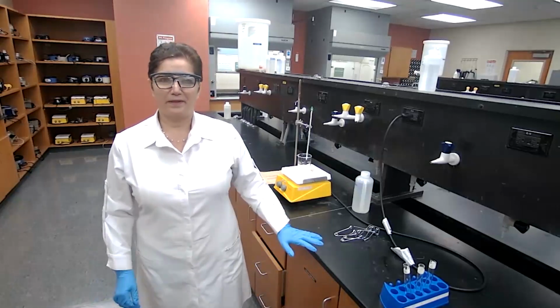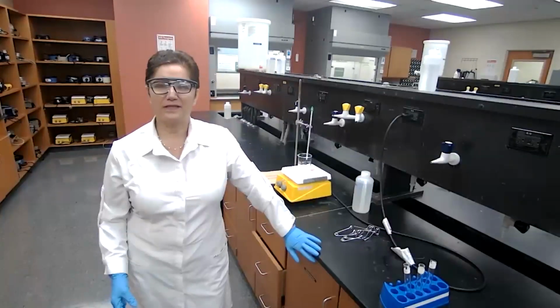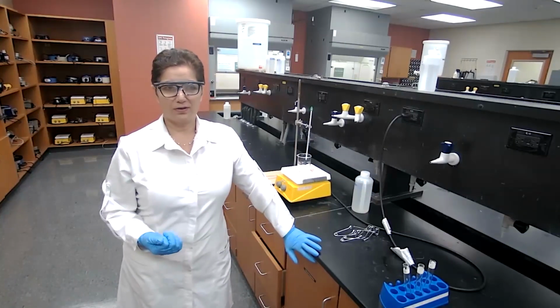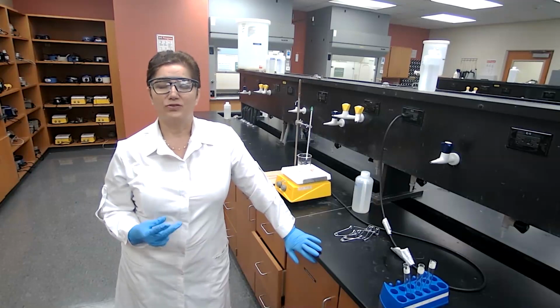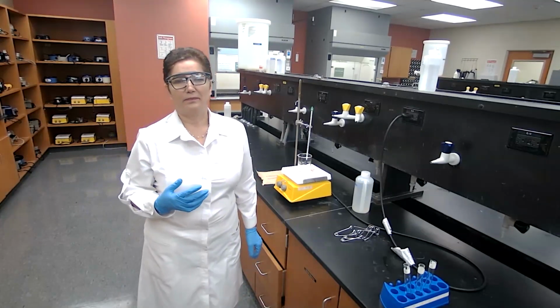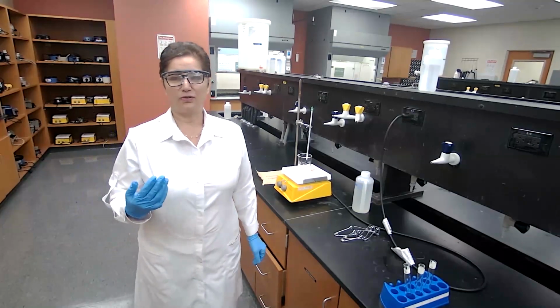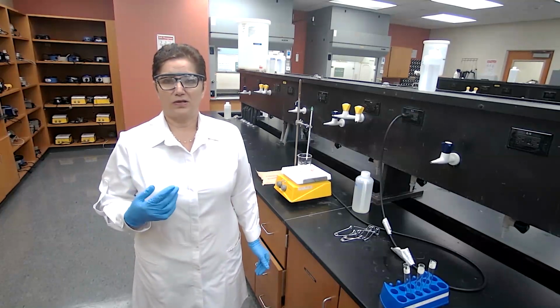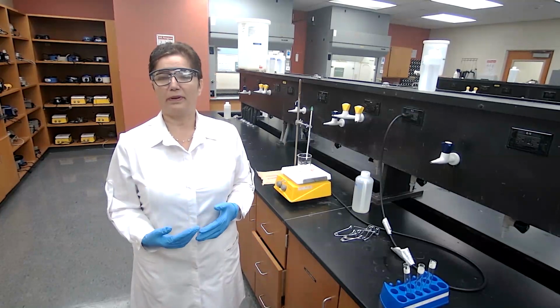Today's experiment is about esterification, preparation of esters, identification of the alcohols, or identification of the acids. Two parts of the experiment, and in part one, based on the lab manual, you will be assigned a group number, group 1, 2, or 3. And also for each group, you have 2 esters to prepare.